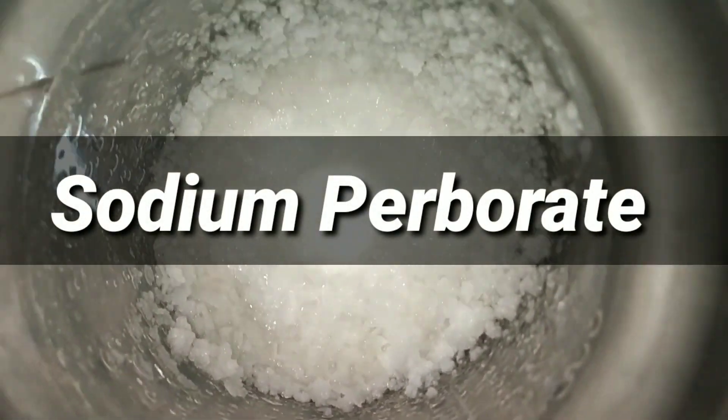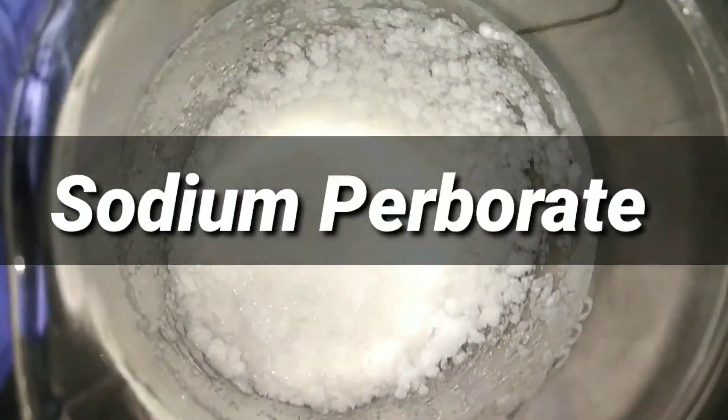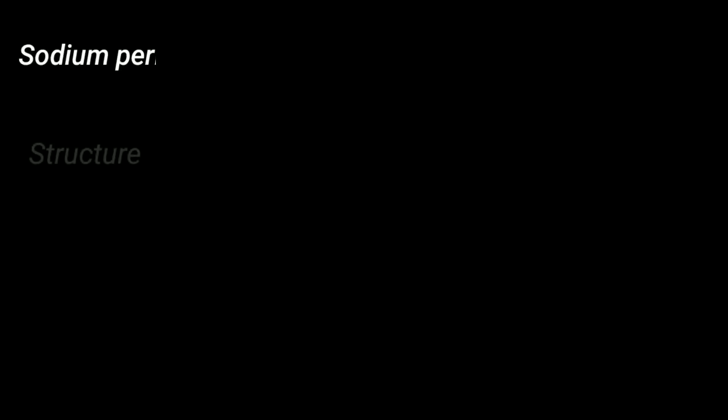Hello friends, in this video we will be synthesizing sodium perborate from easily available chemicals.